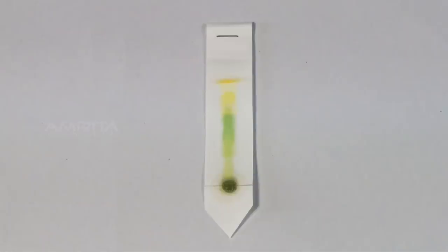Observations: The dried chromatographic paper strip shows four distinct pigment bands. Different pigments can be identified by their colors.